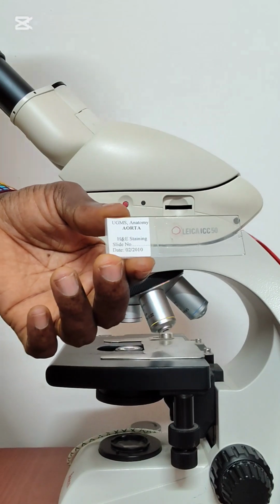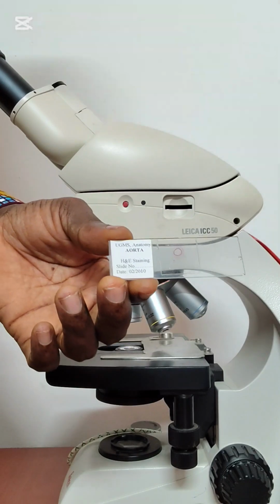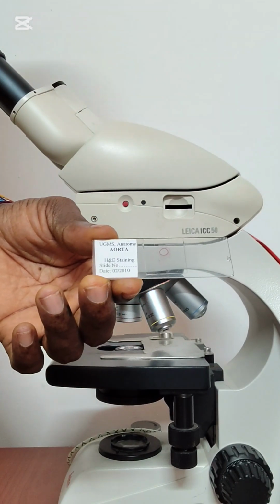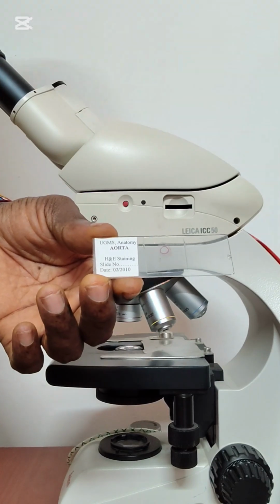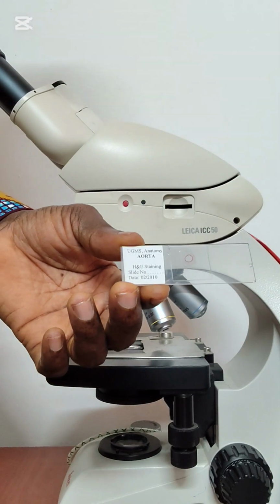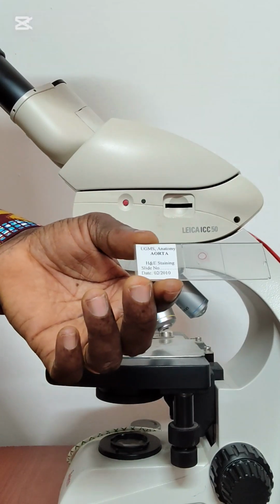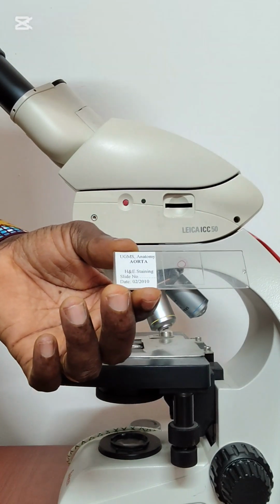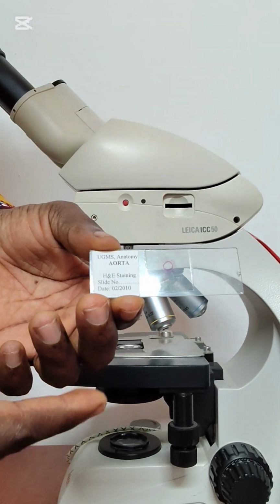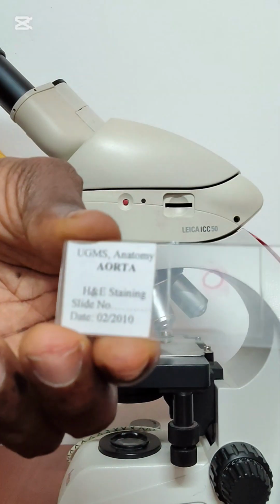You also have to dehydrate the tissue in graded alcohol. Then you clear the alcohol that you used in dehydrating, do your infiltration, and then do the staining. The common stain we use is H&E, which has given us this pinkish appearance.